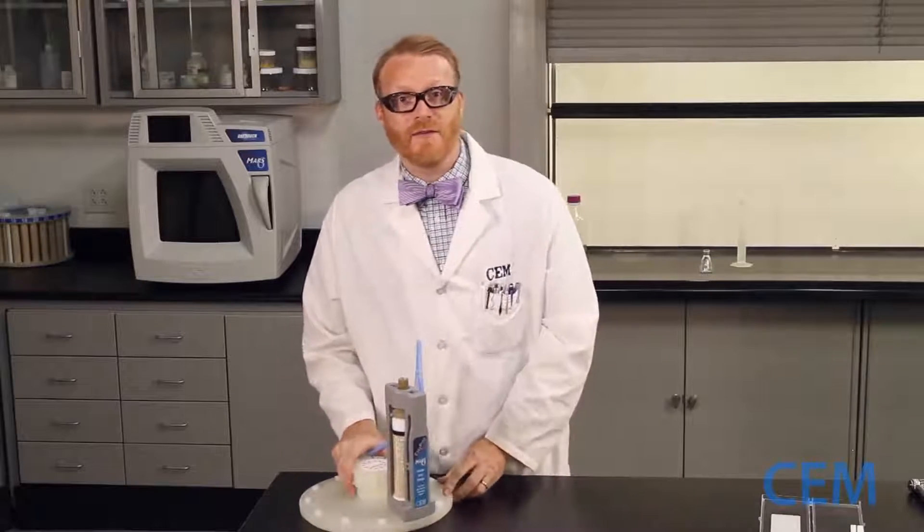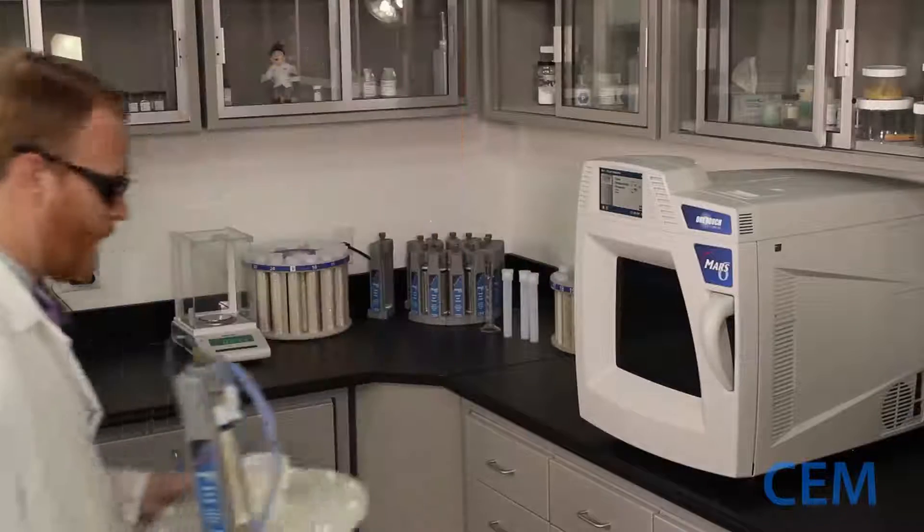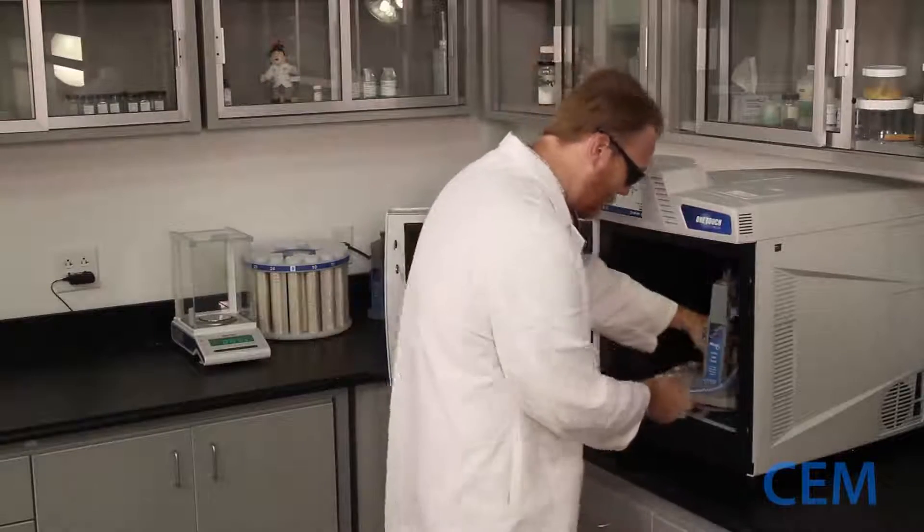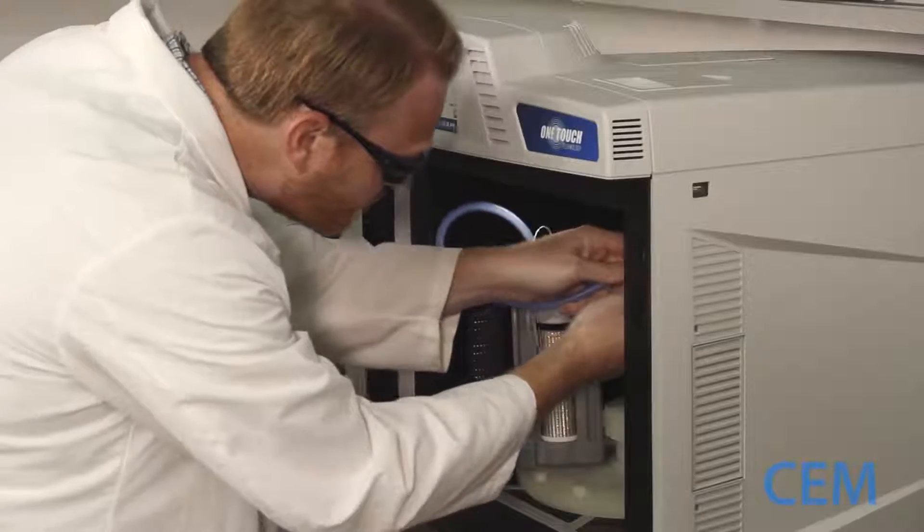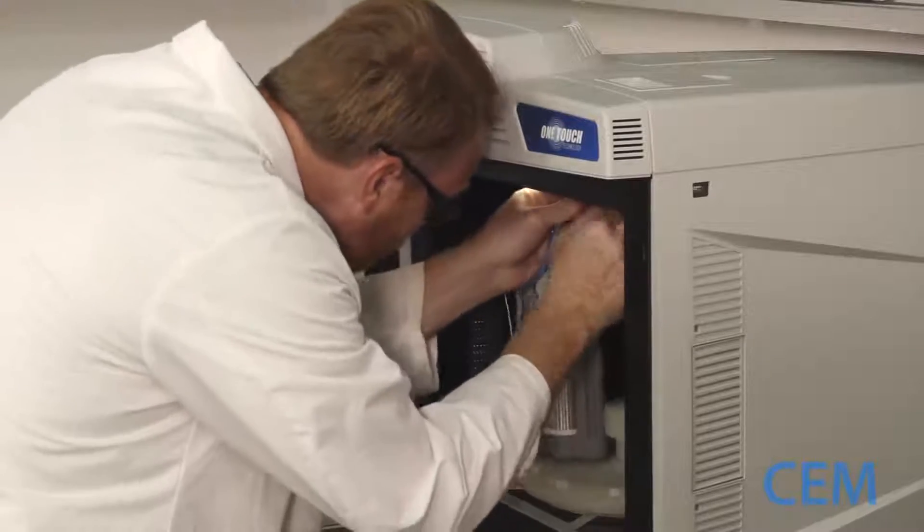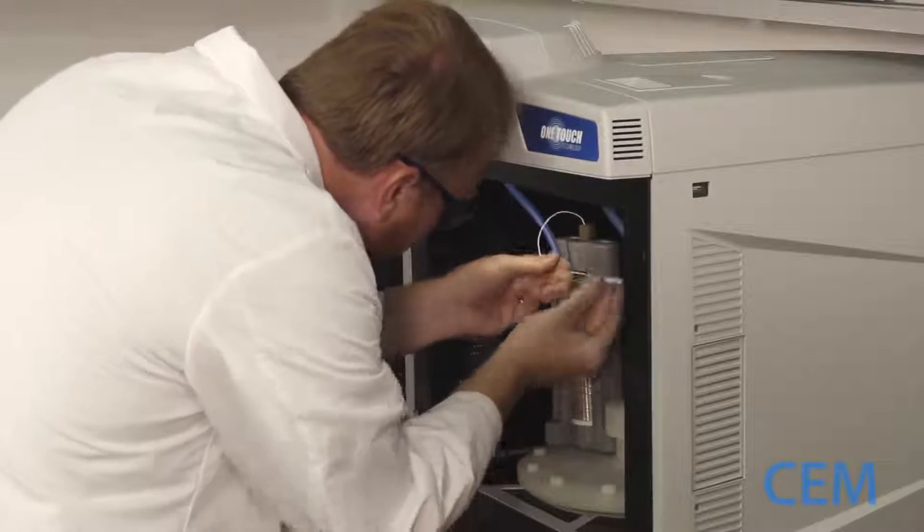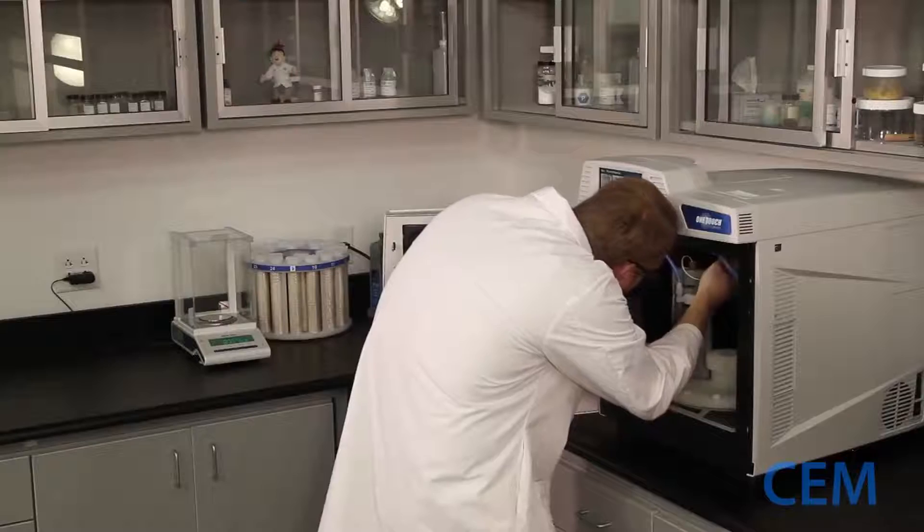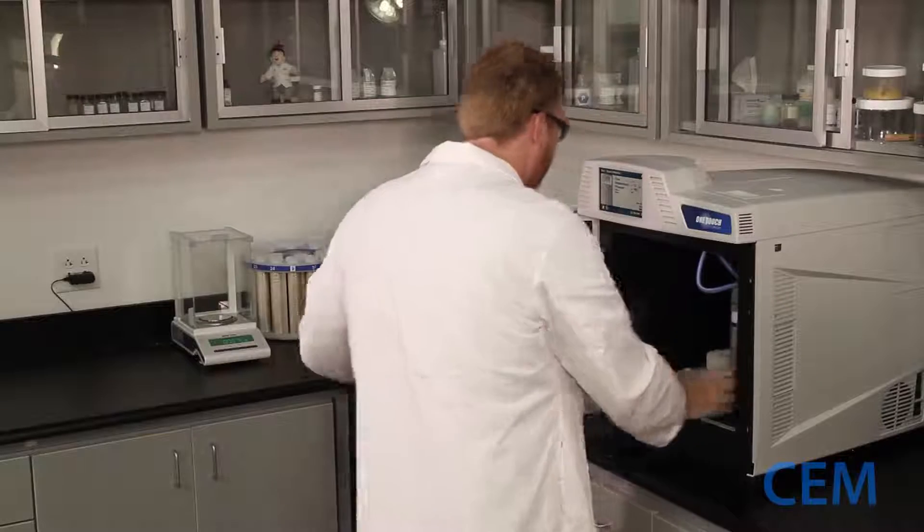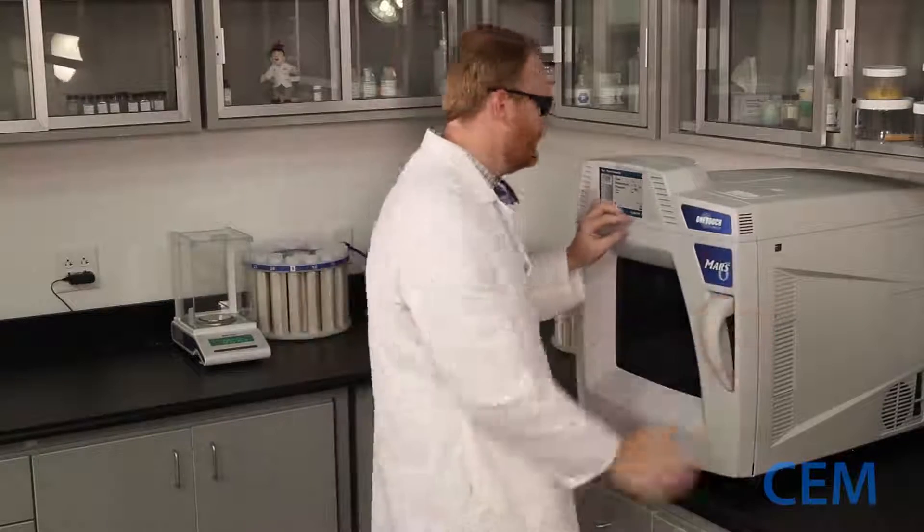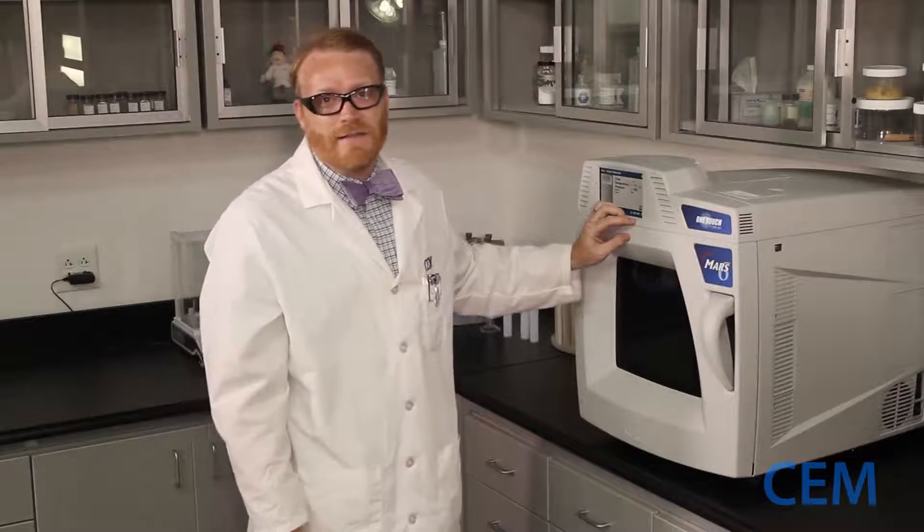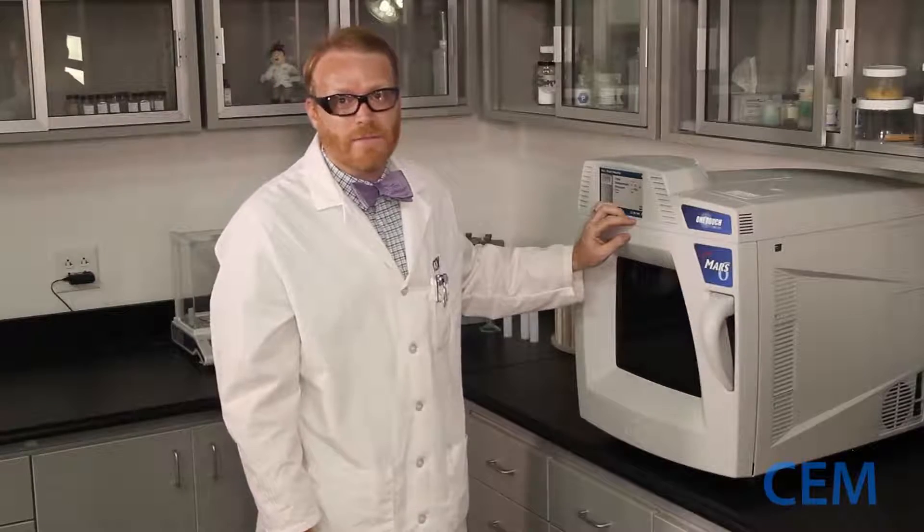And we're ready to move to the microwave. And now it's time to digest it. Or as I like to say, smoke it.